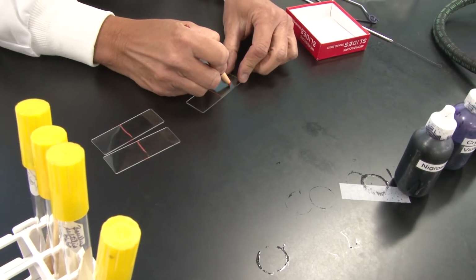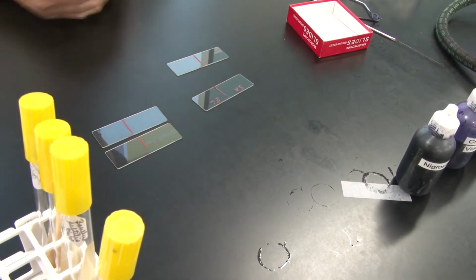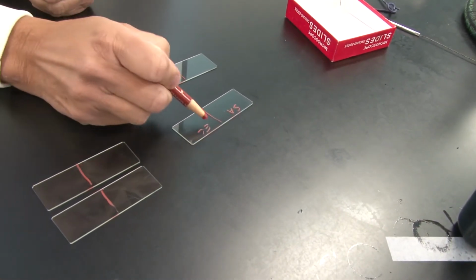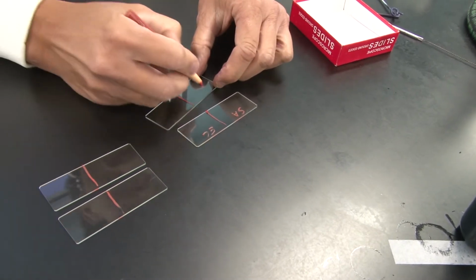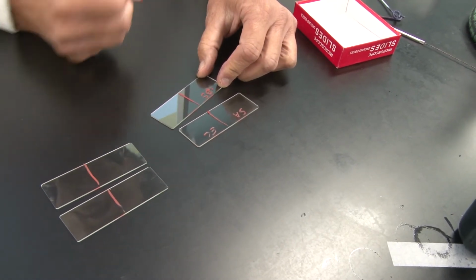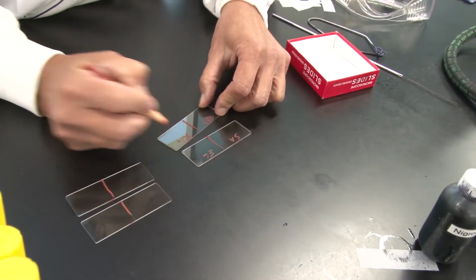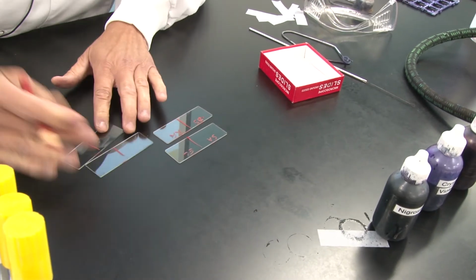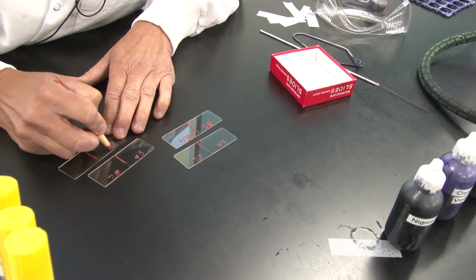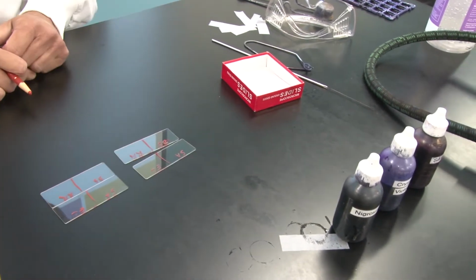On the first slide, I'm going to put Staph aureus on one side and Escherichia coli on the other. Notice I'm using a 2 initial system here, SA meaning Staph aureus, EC meaning Escherichia coli. I said we are also using Bacillus subtilis. It has some unfortunate initials. And we are going to use Rhodospirillum rubrum, RR. So I am going to label these on the other set as well very quickly. Notice I'm using a grease pencil because that wax stays attached to the slide no matter what.